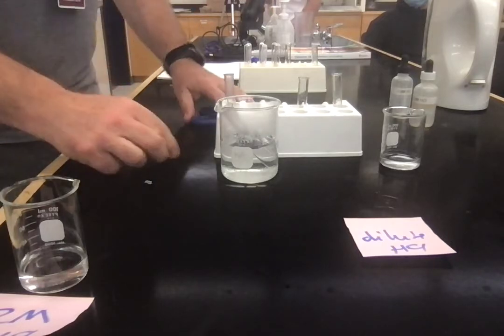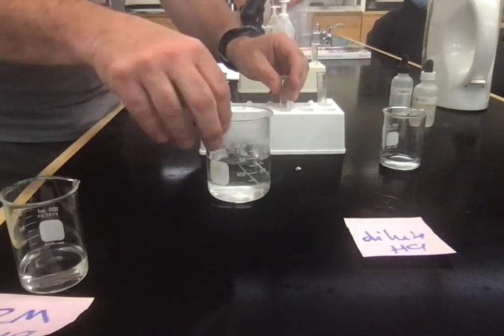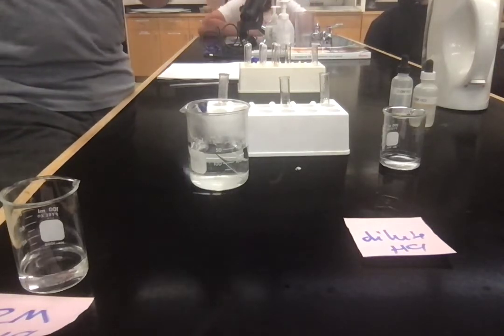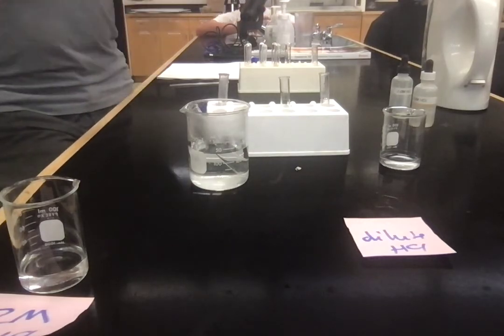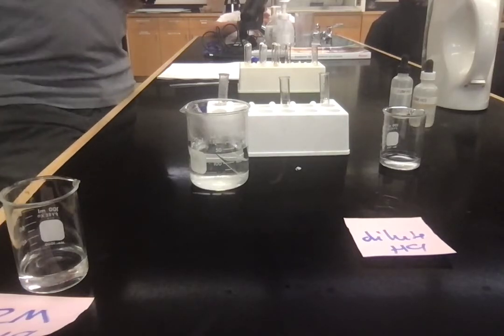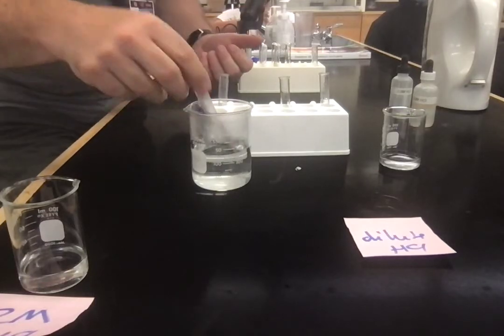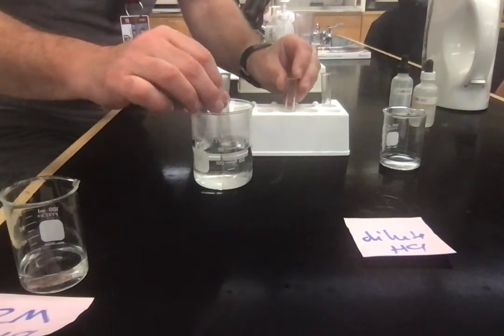Now, what's the difficulty of measuring? What were the things that we looked at for the reaction rate just now? We looked at the fizzing, we looked at gas production, we looked at temperature. Is that going to be a thing this time? Am I going to be able to use temperature to figure out why, because it starts at a higher temperature? If I had a thermometer, what could I do? You can calculate it. So it is possible, just not with your hands, because it's like, oh, that one's hot. Well, yeah. Okay. Let's see if this actually works this time. So, into there and into there.